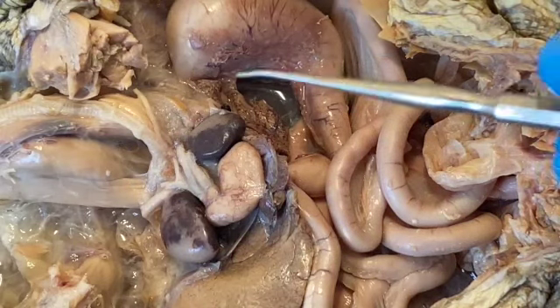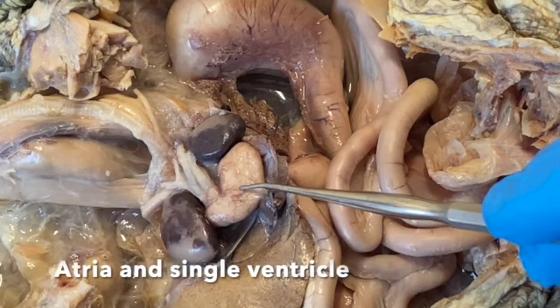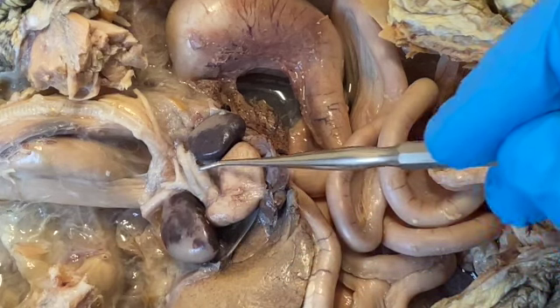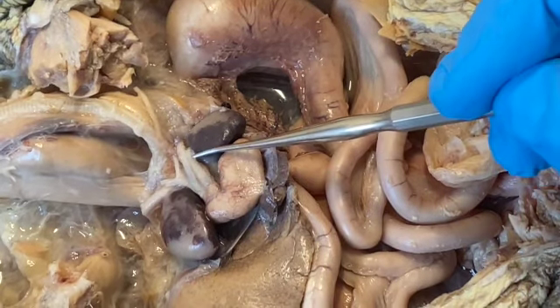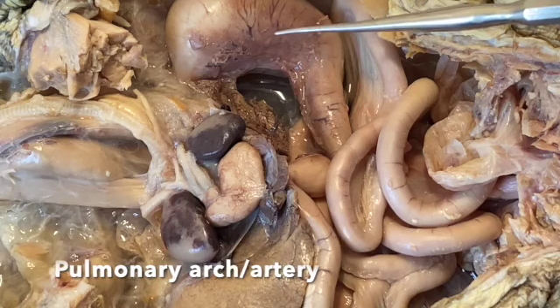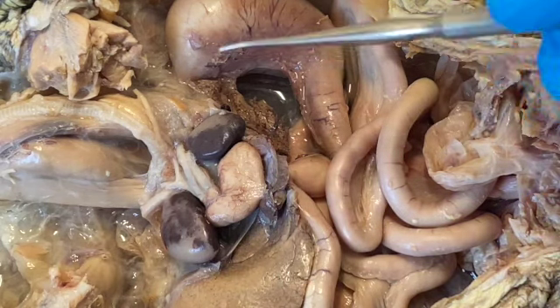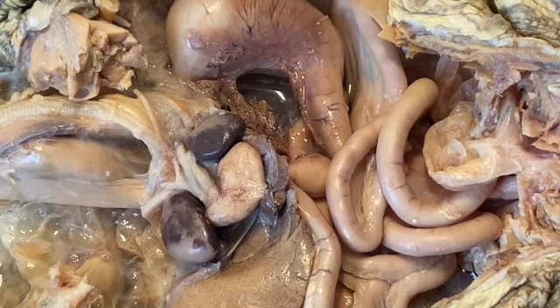What we can see again is the left and right atria, the single ventricle, and then there are some large vessels that are coming out of the heart. This one, the first one on the right, is the pulmonary arch or pulmonary artery. This is going to carry blood to the lungs, which are not yet exposed. They are along the dorsal body wall.